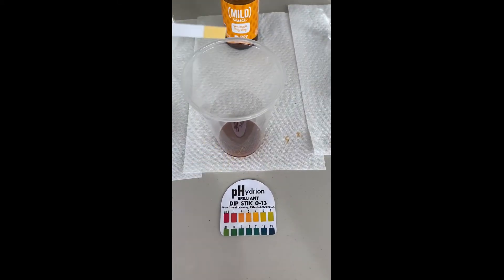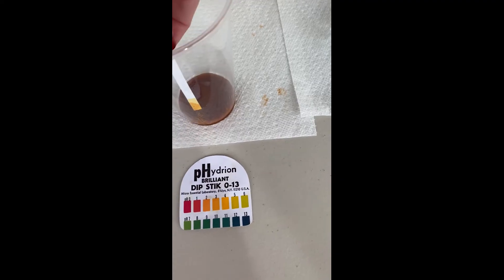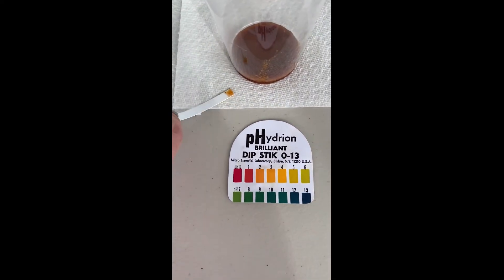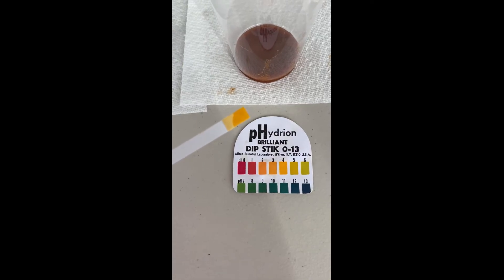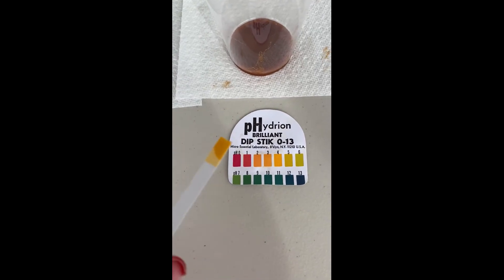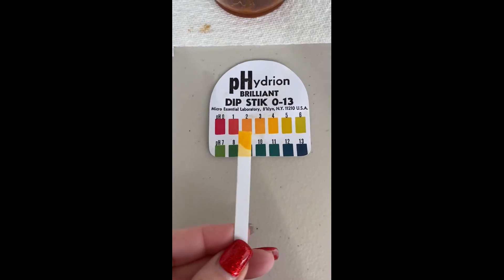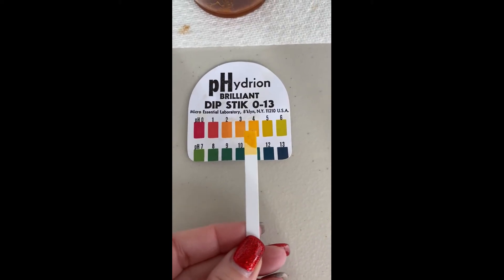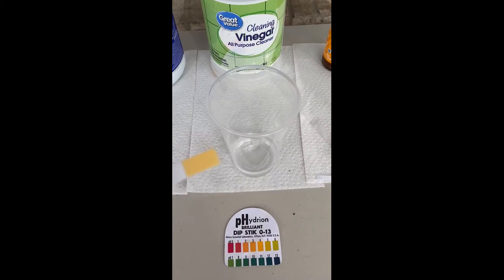Go ahead and move to hot sauce. We're going to dip it in the hot sauce and give it a second to turn colors. I wiped some of the spices off so it wouldn't interfere with the colors. Then you can match it up, and you can see that this one's going to be right around a 3 or 4 — so very acidic, hot sauce.